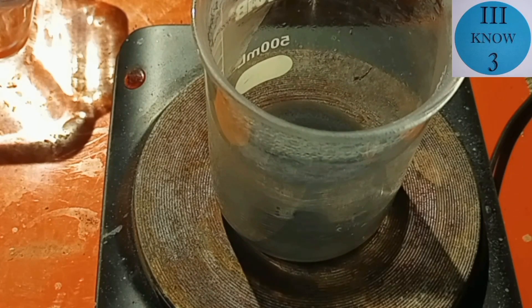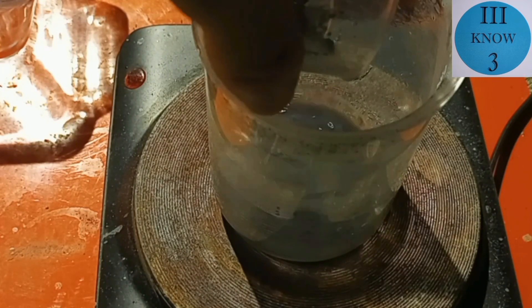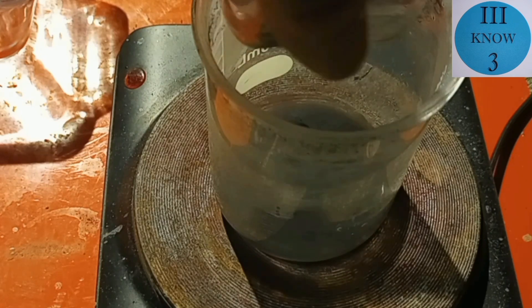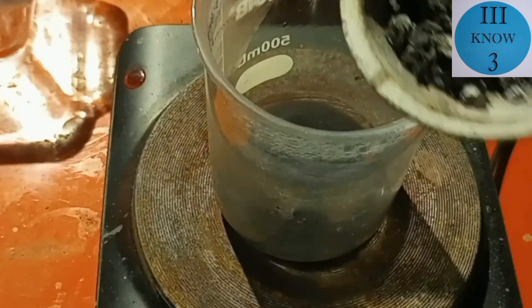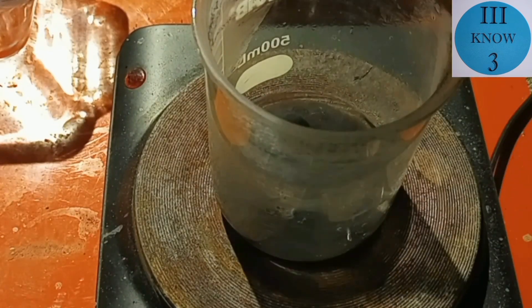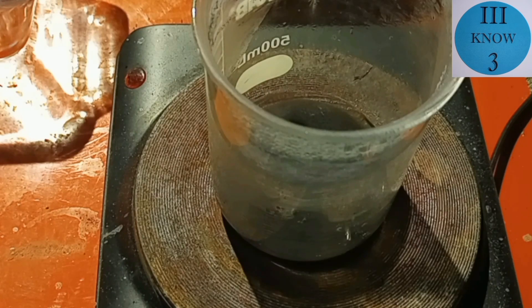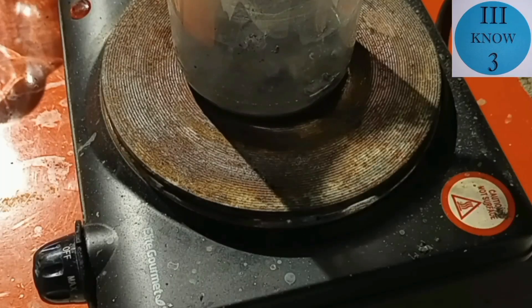I kind of repeated the same process that I showed before. I just didn't film it this time. We have a fairly clean solution of what looks like zinc acetate and there's all the leftover sediment that was in the bottom. And then to this sediment we were going to add all the precipitated metal that we collected. And we're going to add this zinc that's got the nickel coating on it. And then we're going to save these for later.